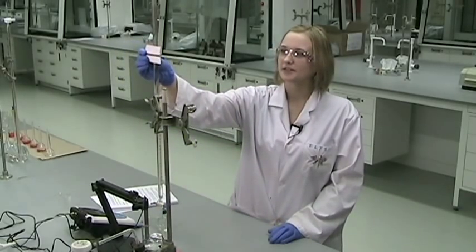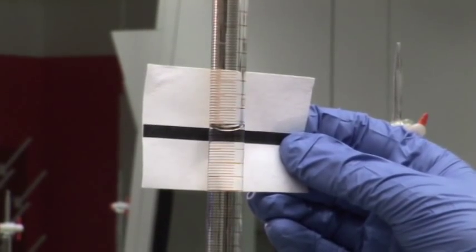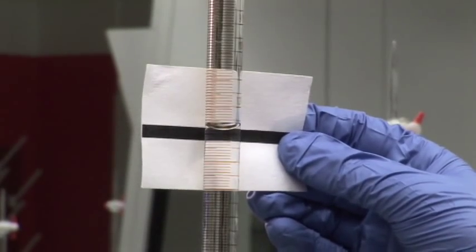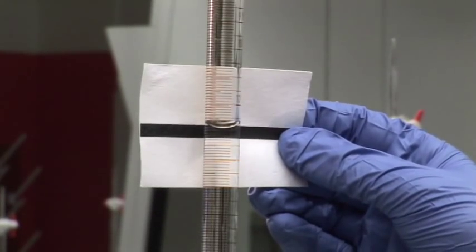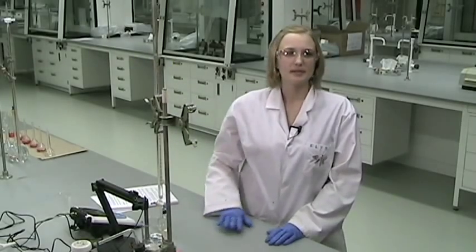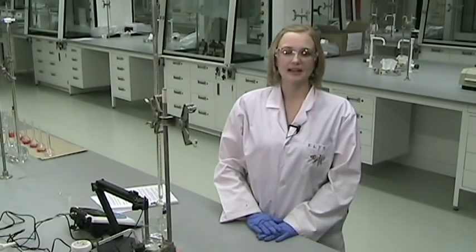So when I'm ready to start the titration, I'm going to take a reading of the volume, remembering to read the burette from the top down, and recording to two decimal places. When I have that value ready to be written down, I will also read the pH off the pH meter for our starting before adding any base.